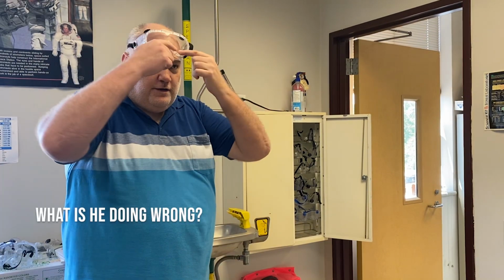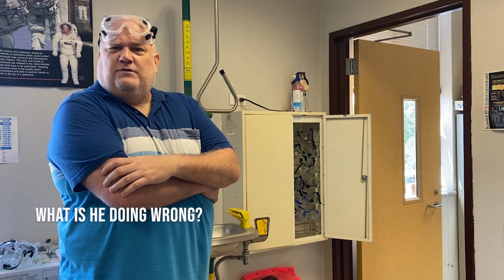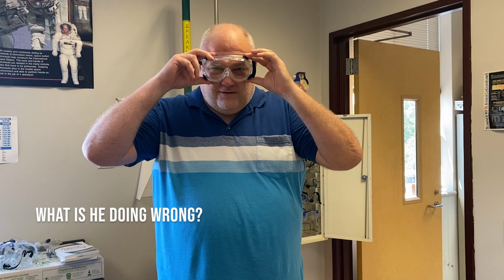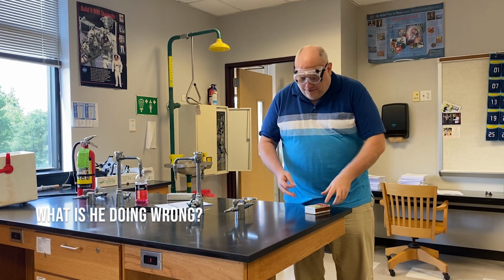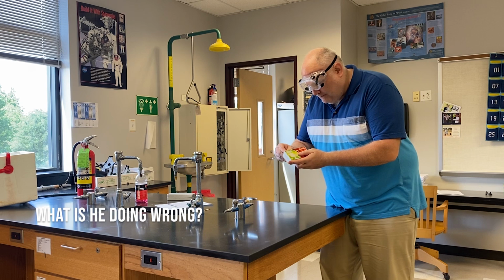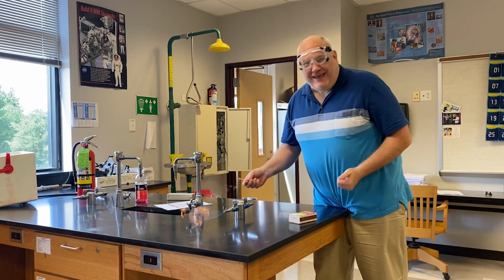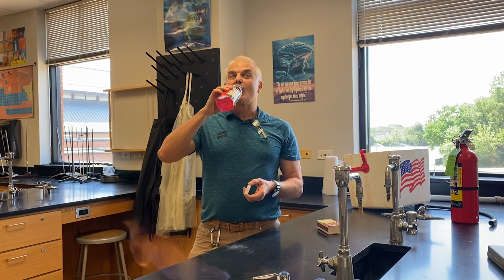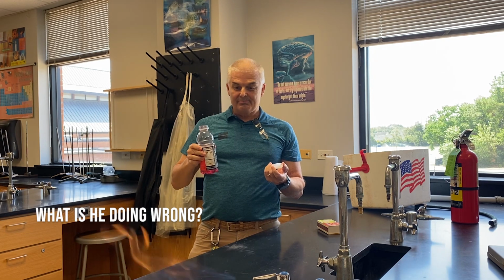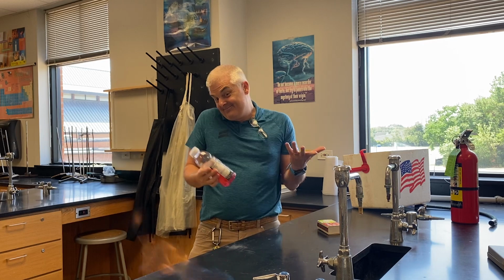This right here is the most prominent part of my head. I feel like this is the most important thing to keep safe. It makes lines on my forehead, so every once in a while I'm just going to lift it up. Whew, he's finally not here. Whee! Man, I'm kind of thirsty. I have a sandwich if you want to eat it right now too. Sure. How about some s'mores? I don't know why I feel like s'mores right now.